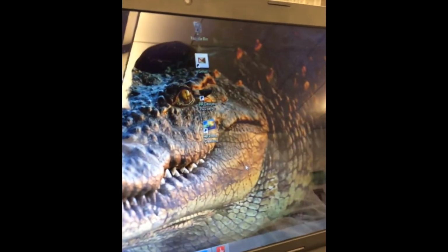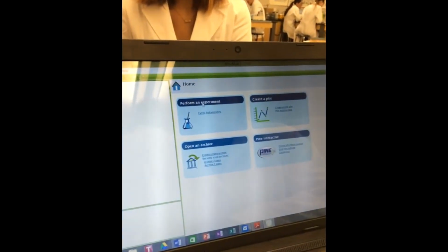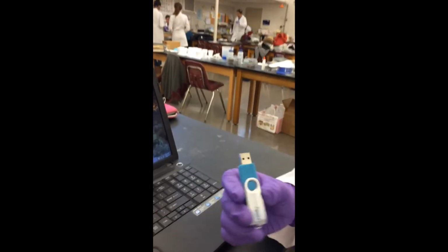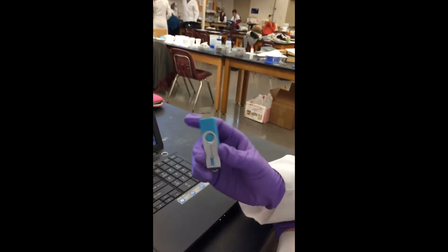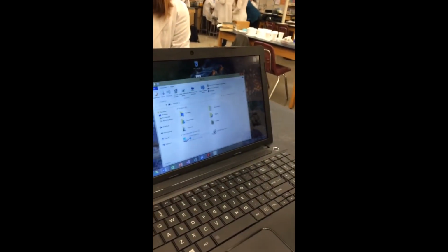However, we learned after calling the Pine software company that you cannot perform the experiment until you have moved a permissions file within the software. In order to run the experiment, we had to take the flash drive that came in the Pine Wave Now setup and attach the permission file to the Aftermath software installed on the computer.